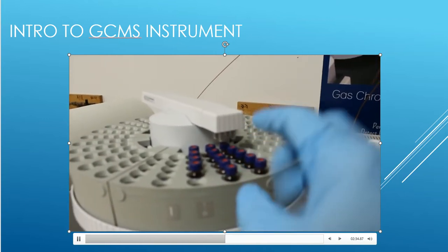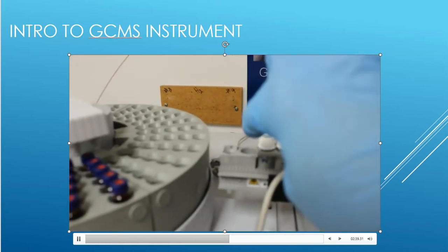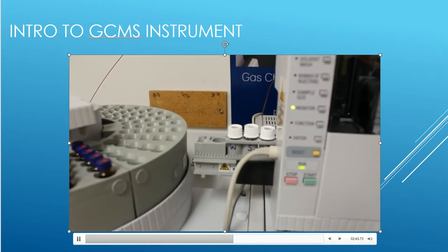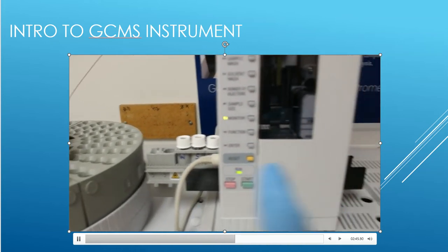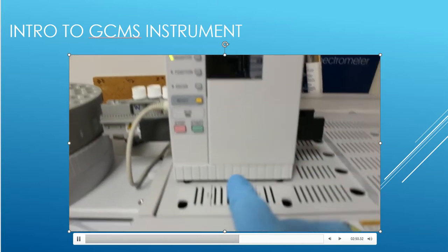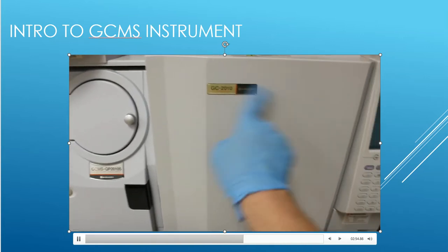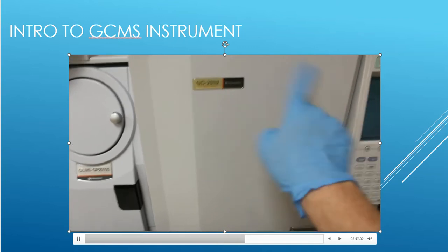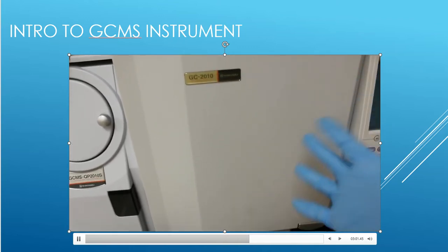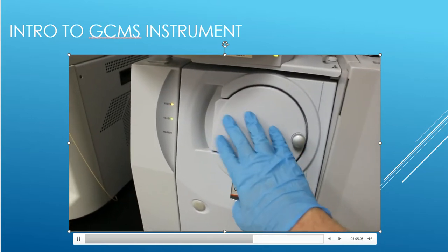This arm grabs it like a grab machine, picks it up, swings it over and puts it into our sample compartment, which is going to be there. And then this will shift back and forth to line up with the needle. That needle injects the sample into the GC system, which is here. Inside the GC system, the sample goes round and round and round. And then finally, that pure compound, as well as all the impurities, get sent over to the mass spec, which is right here.